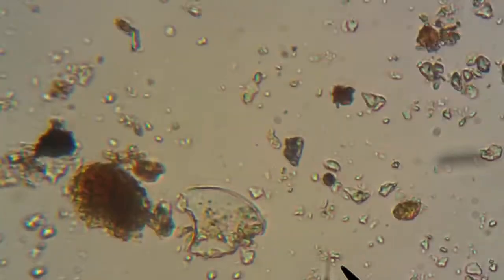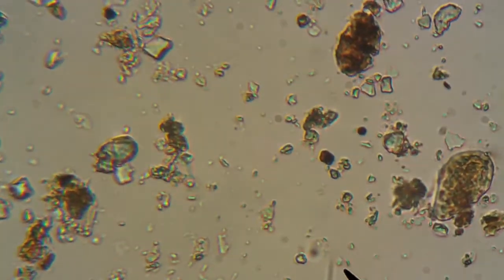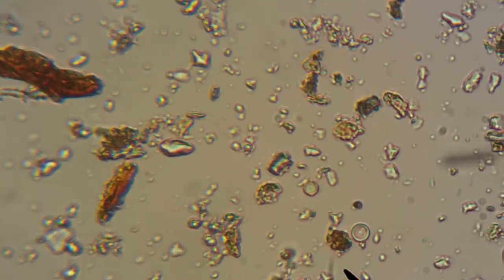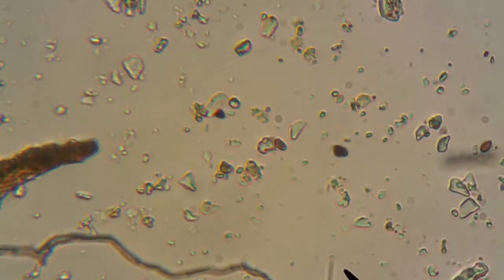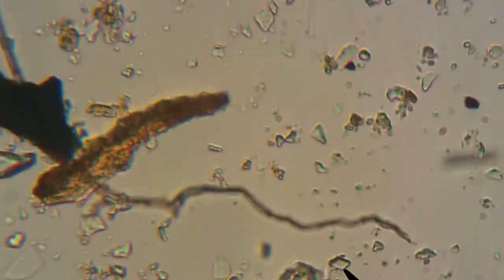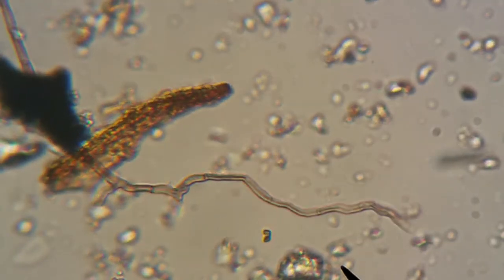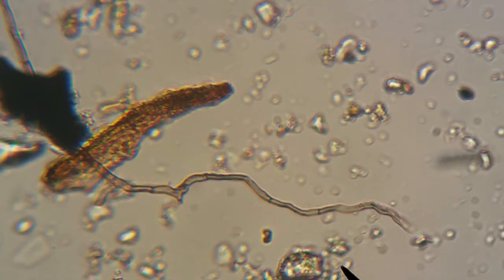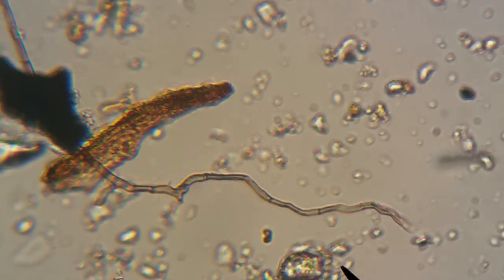Now again, this soil was cold — we still haven't completely hit spring, even though it's the end of April. So I will keep the sample inside for a day or two and we will do this again. What looks like a bit of root matter — yes, we've got divisions on that, that is root — and we will go from there.